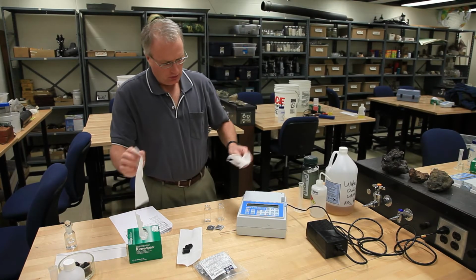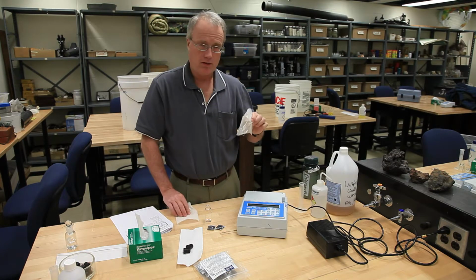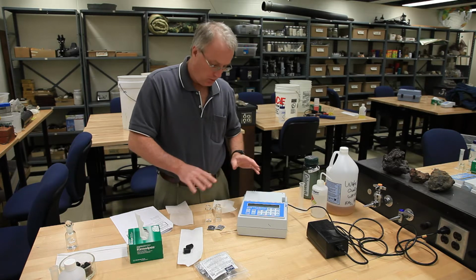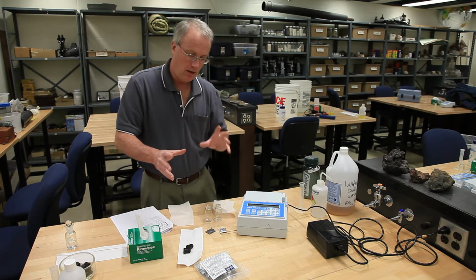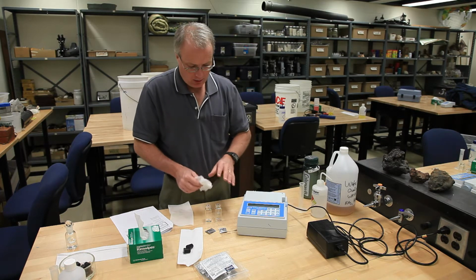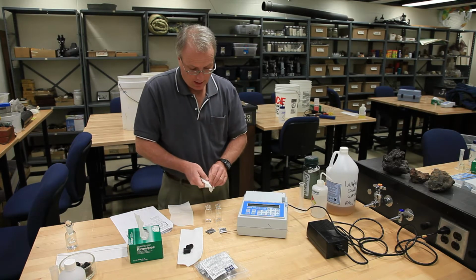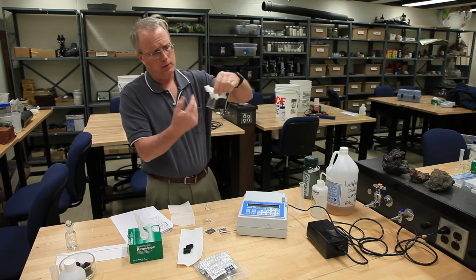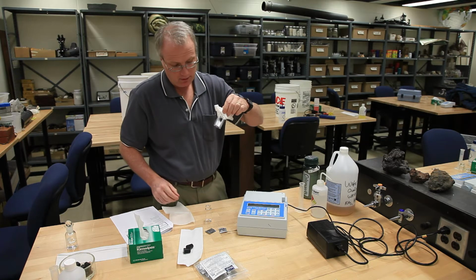I just want to show you a little bit about handling these cuvettes correctly for both the phosphorus and the nitrogen test. You're going to be adding sample water to these. You're going to be adding powder pillows to these. I've already talked about how to swirl and shake correctly. I want to talk about the final step where you're going to put them into the machine. So as always, you never touch these with your hands. So I have my sample in here. This one, as you can see, is empty, but during the test you'll actually have some sample in here.